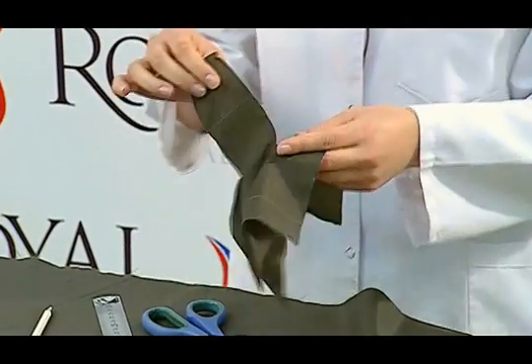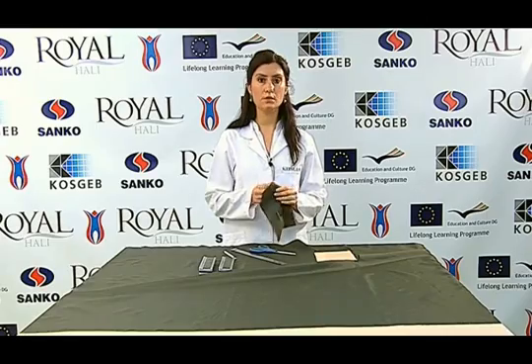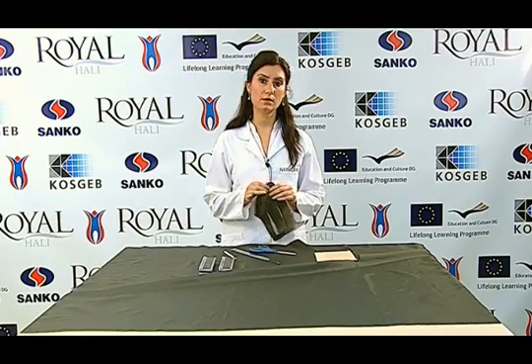As you see, a tongue-like shape is formed, and the prepared test sample is tested with the universal testing device.